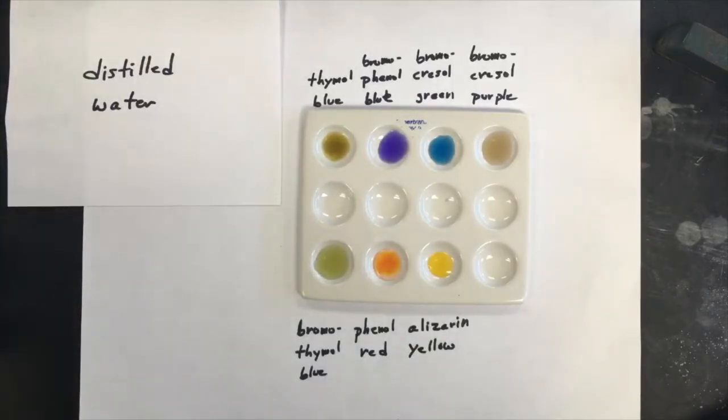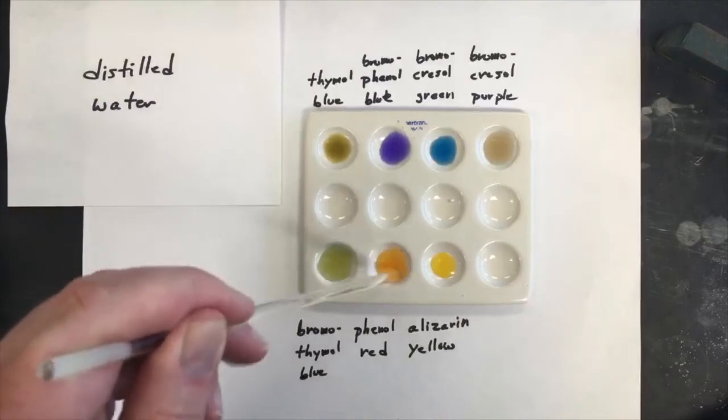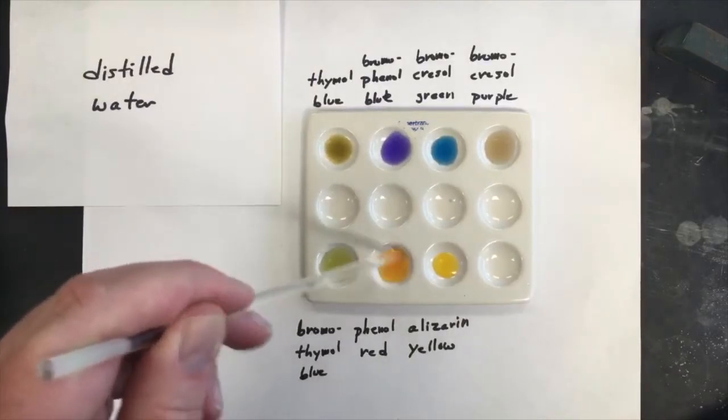These are kind of pale, those two colors. But I think that's just, maybe I should add a little bit more indicator.